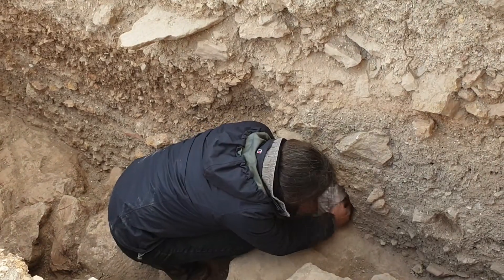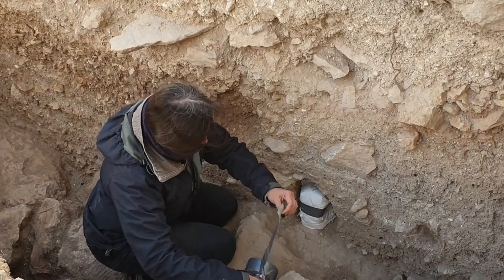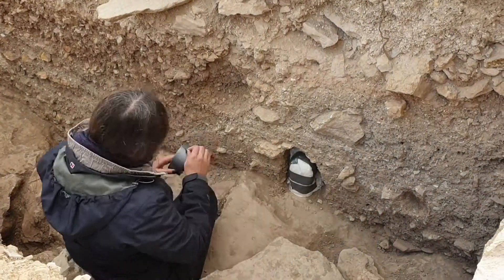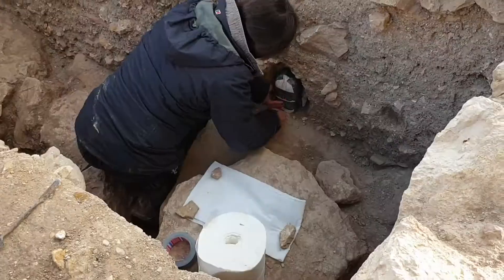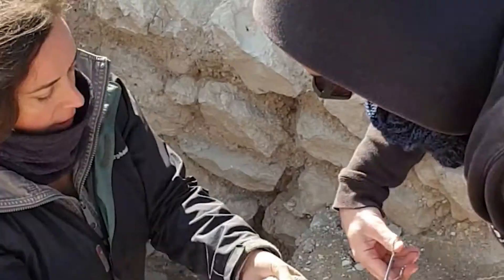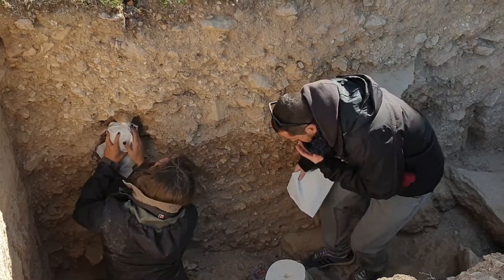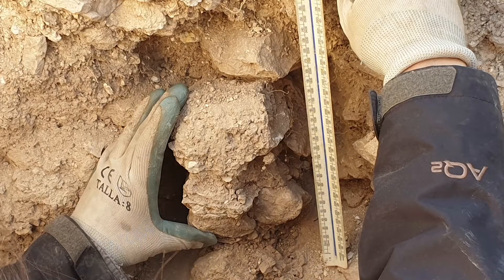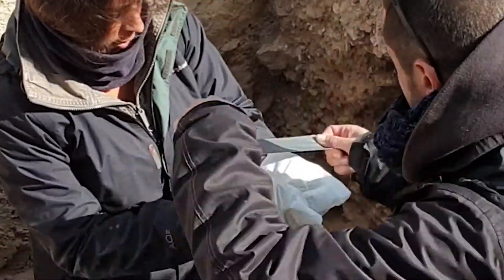The sample, which consists of a small block, is cut out of the profile of sediments. These sediments represent layers of materials that have built up inside this area. The layers can represent floor surfaces, accumulations of residues from various activities, and collapsed building materials from periods of abandonment. It is important to keep the block intact. It is tightly wrapped and labelled with its location and orientation. The block is then taken back to the lab to prepare what is known as a thin section — effectively taking an intact part of the archaeological site back to the lab to study under the microscope.